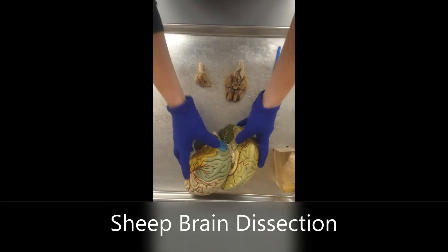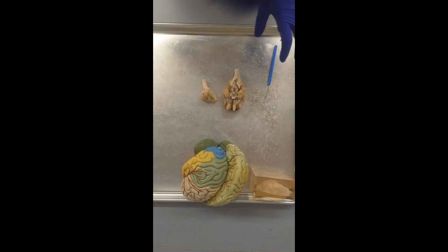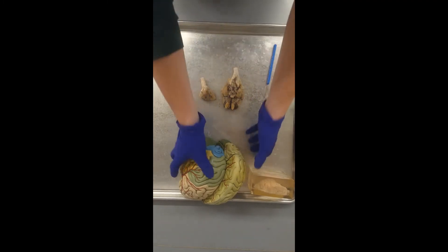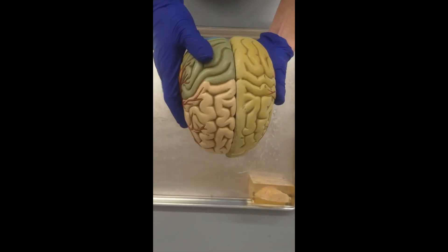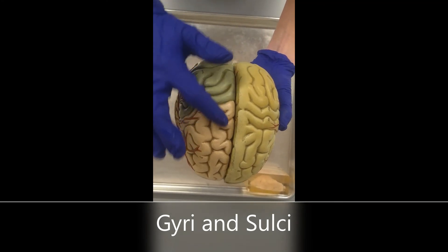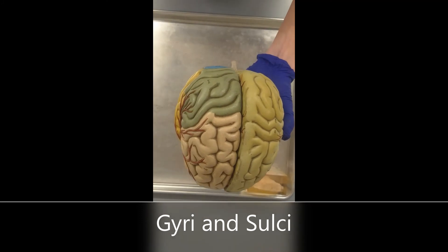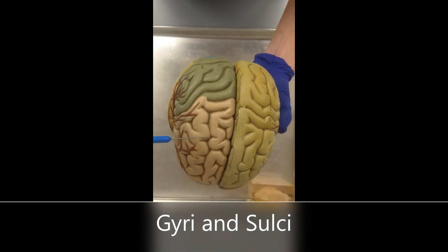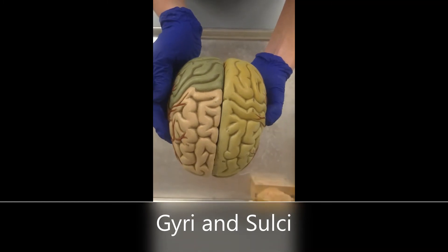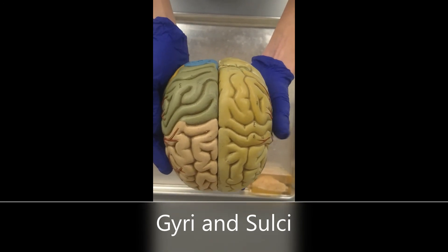We're going to go ahead and get started. For our identification list, we're going to start off with gyri and sulci. Gyri are going to be the raised folds that give the brain its wrinkled appearance. Sulci are going to be the indentations and grooves in between the gyri. We also have some fissures in the brain — fissures are going to be deeper than the sulci.